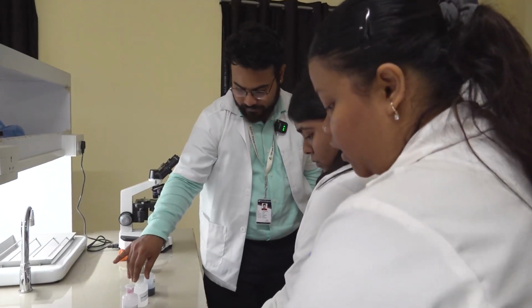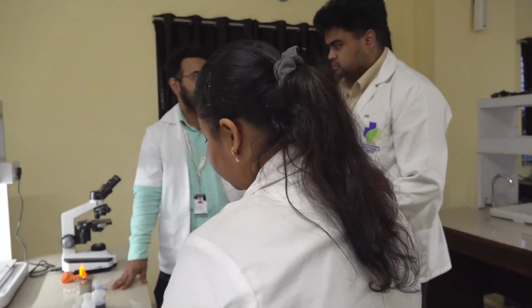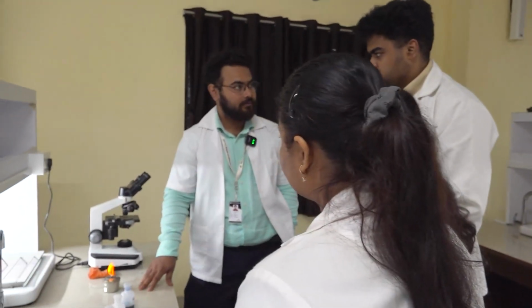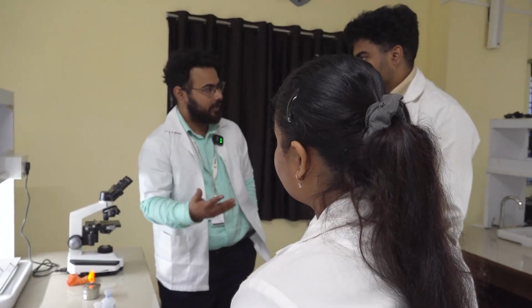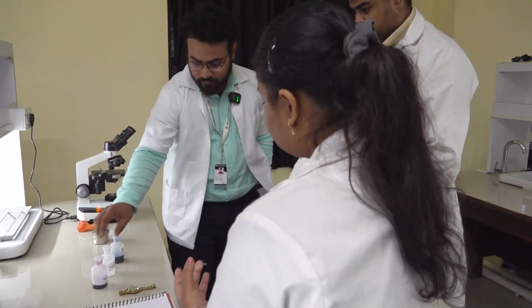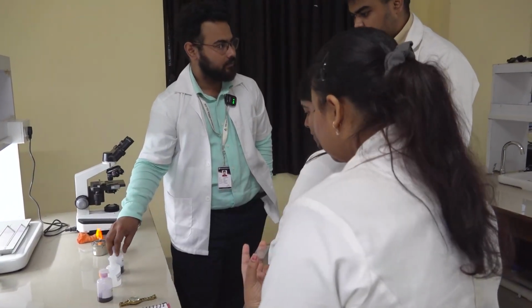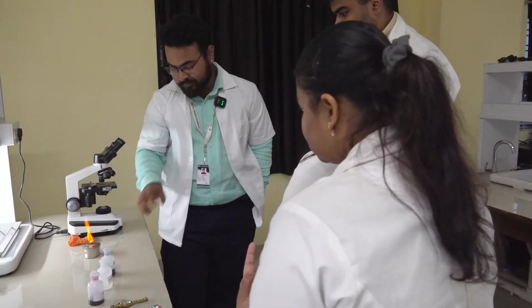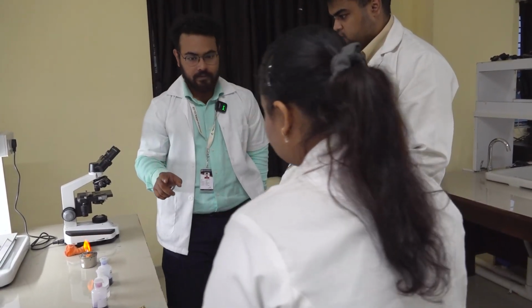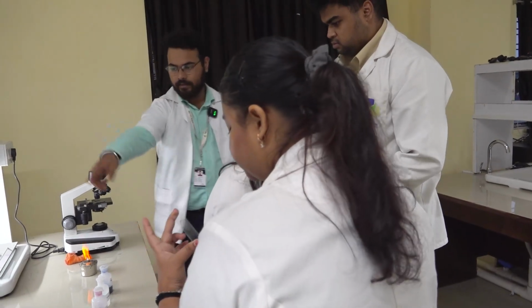Carbol Fuchsin, acid and methylene blue. So in case of gram staining, it was come in and stain, okay, like after you did enter the lab, you came. So CAM, remember it like this. Carbol Fuchsin, acid and methylene blue. Okay. So Carbol Fuchsin, you will pour for 5 minutes. I'll do it on one slide. You can do it simultaneously also. Okay. Please take that one.